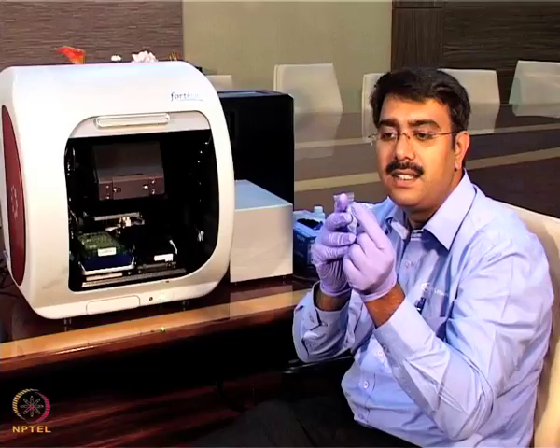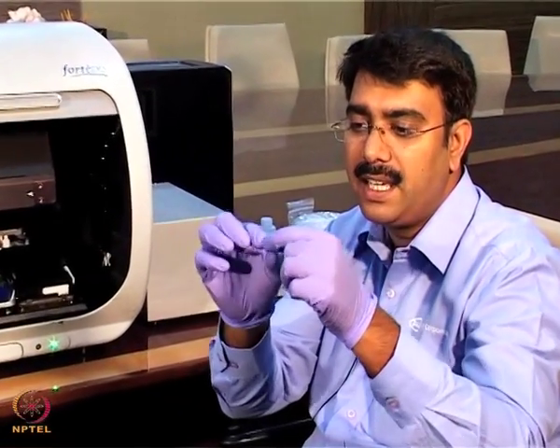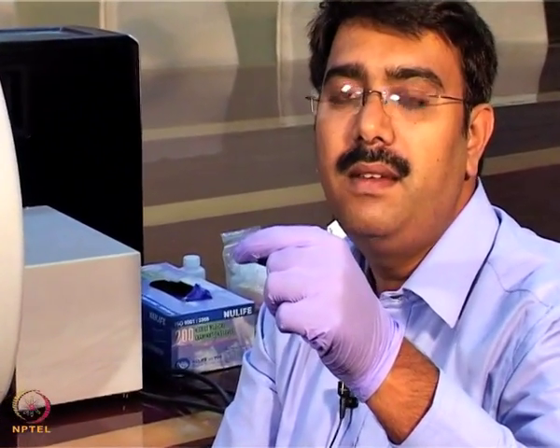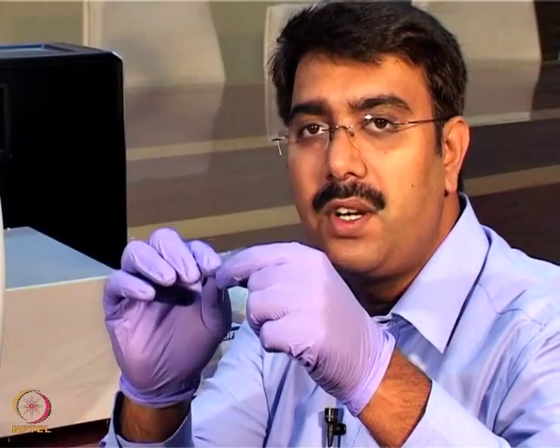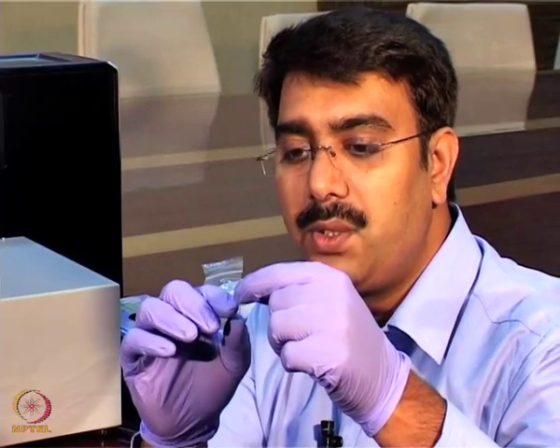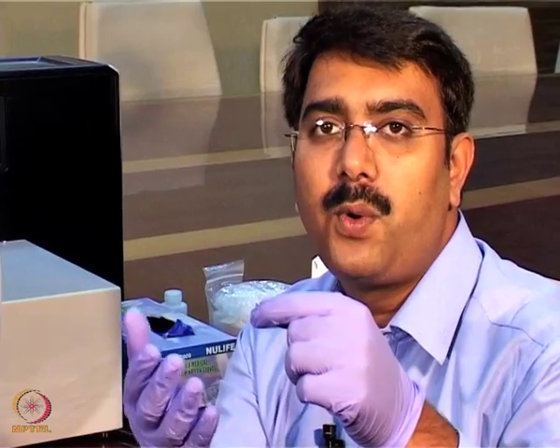At the tip of the sensor we put the ligand of our interest. So we pass a white light, and the light gets reflected back. It is a reflection based phenomenon. One light is coming from the internal optical layer, and another light is coming from the ligand end. So when there is an interaction between the two binding partners, say suppose I am coating with a kind of matrix, it is protein A.